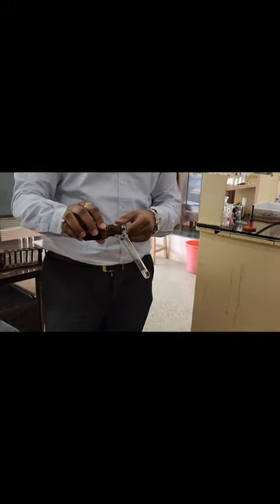This AgNO3 will turn this into a curdy white precipitate. Curdy white precipitate because Ag and Cl will combine with each other to form curdy white precipitate.